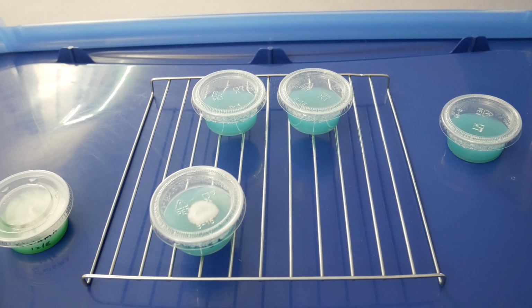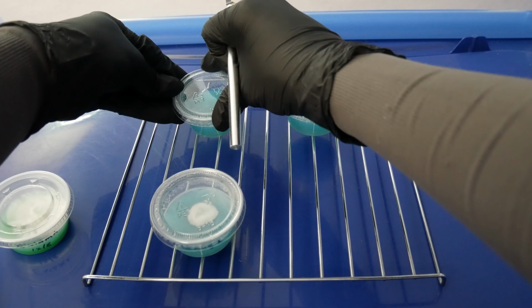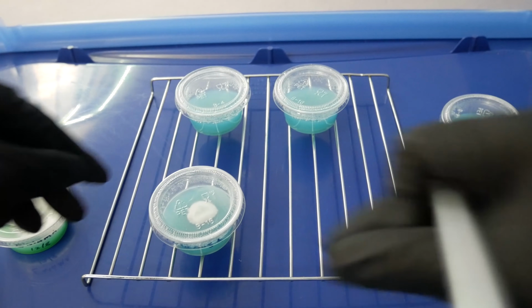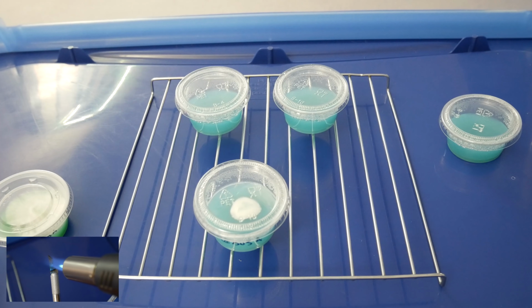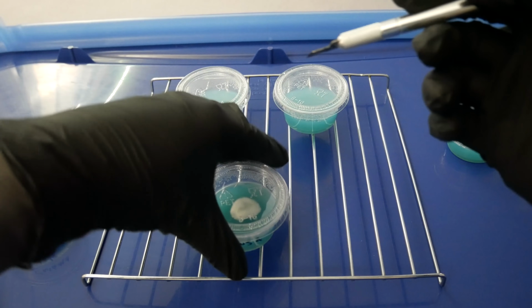All right, now moving on to the next dish here. I'll show you guys how I go about this. I like to pre-open my lids to the agar cups, as it makes it easier to not have to fiddle with them when you're carrying mycelium on your blade. So here's a quick tip there. Just pre-open your lids, get them ready. That way it'll be much easier to lift them up and make transfers. So go ahead and flame sterilize your blade, make sure it's clean.